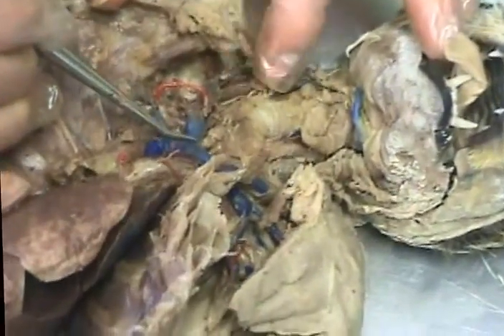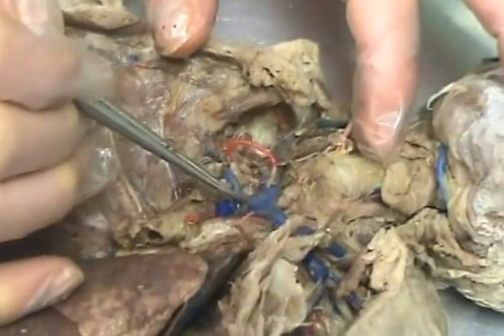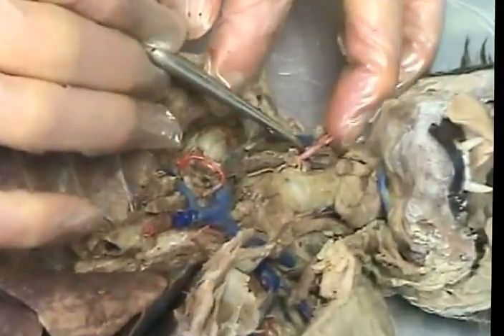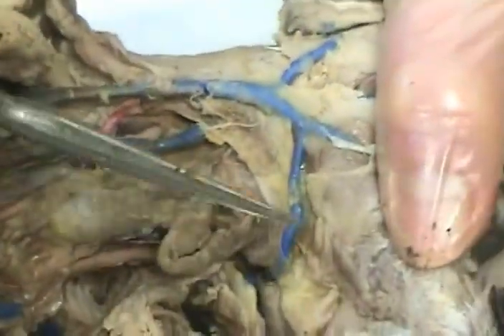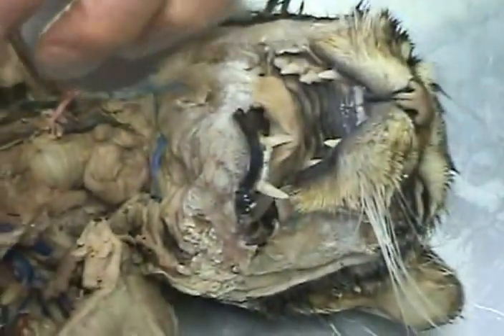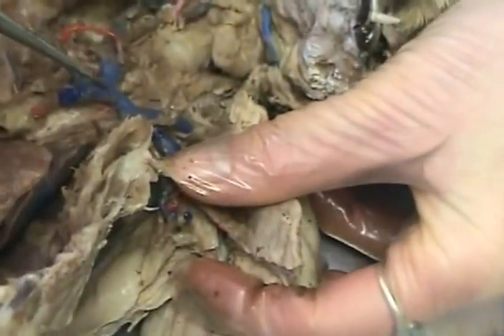Brachiocephalic right here, and the external jugular dumps into the brachiocephalic to the vena cava. You should have. Oh, this big one. Yours is big too. Is the internal jugular vein. If you follow the external jugular vein all the way up to the side of the face, you have transverse jugular going across the throat, posterior facial to the back of the face, and anterior facial to the front of the face. The arm, if you follow up, again we are at the veins.